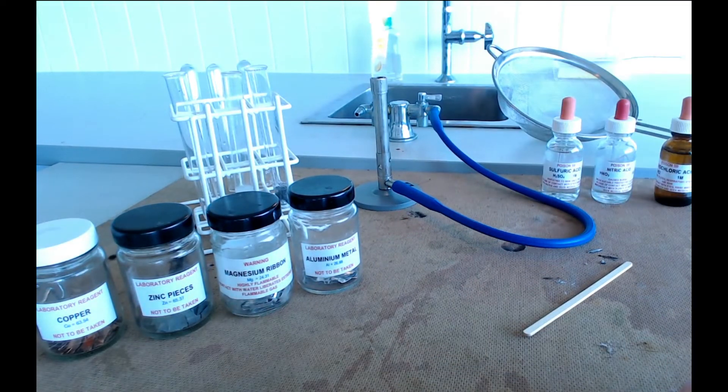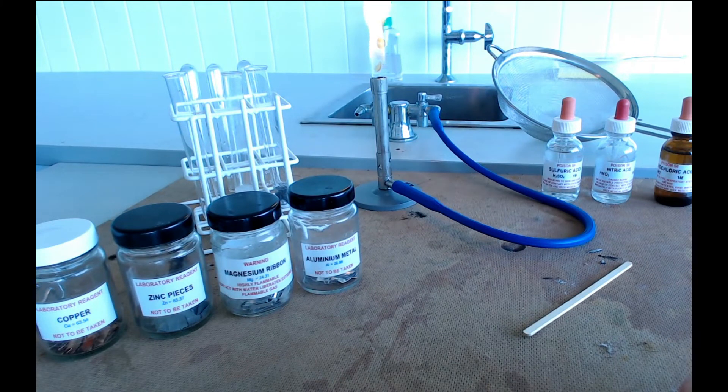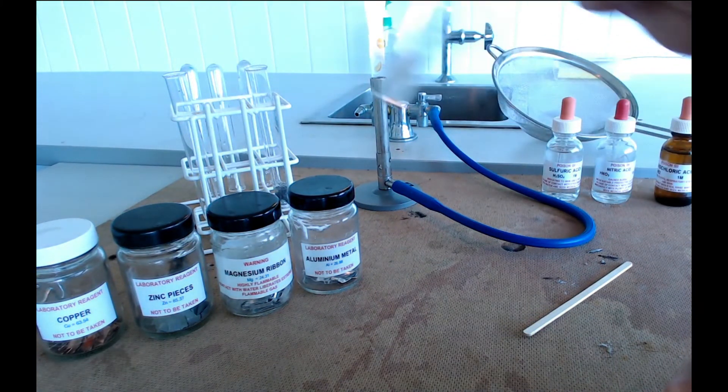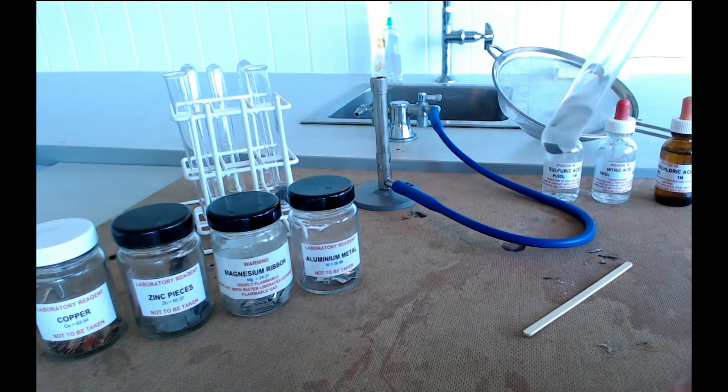Now if your metal produces a gas you're going to see that because there's going to be fizzing in the test tube. So this one's been fizzing away a bit.